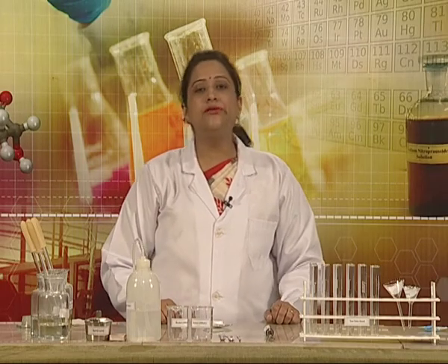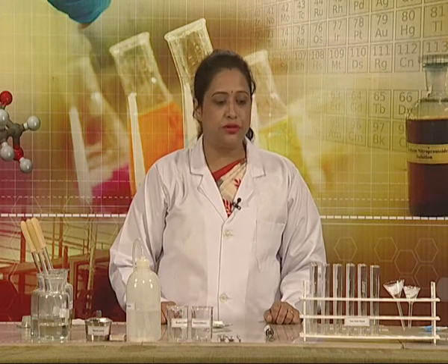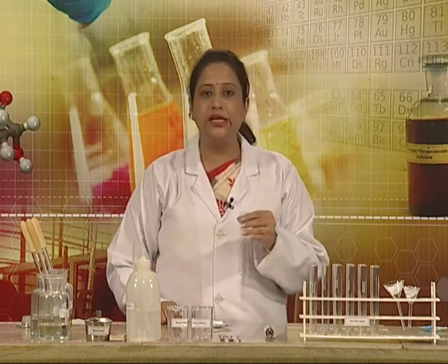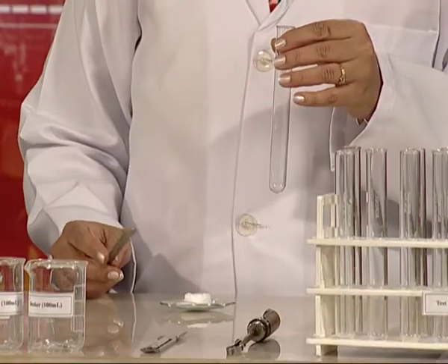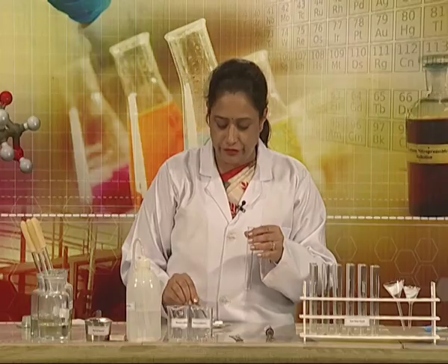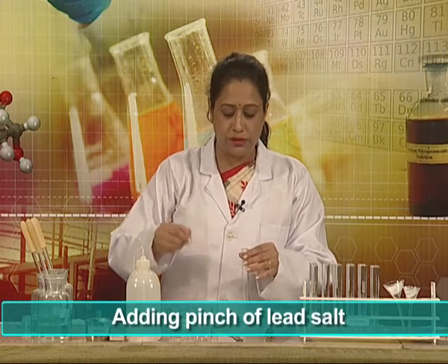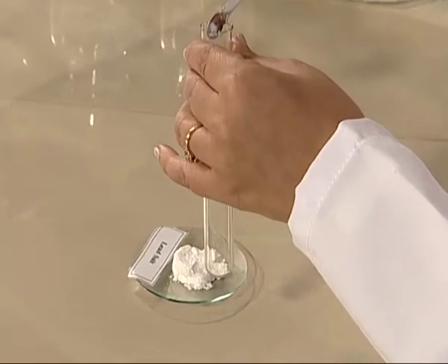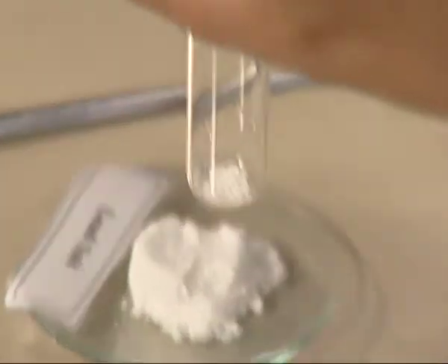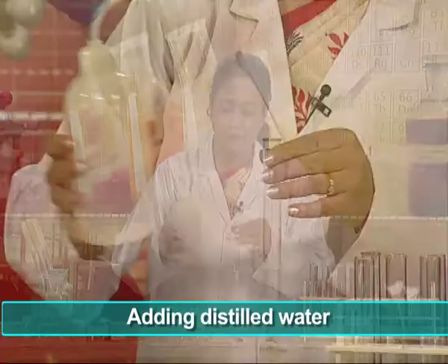First of all, we will prepare our original solution. For this, we need a test tube. To it, we will add a pinch of lead salt and make the original solution by adding distilled water to it.